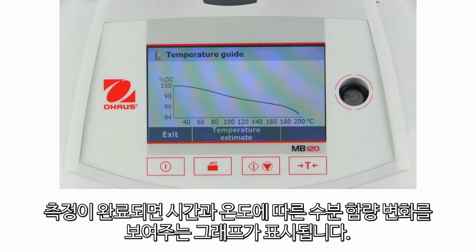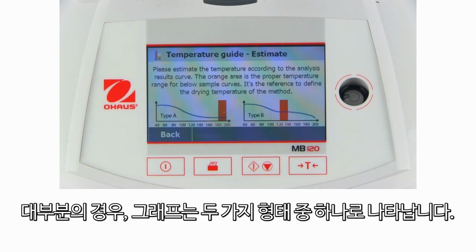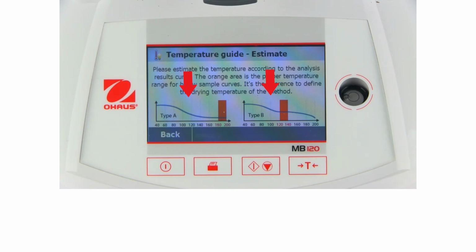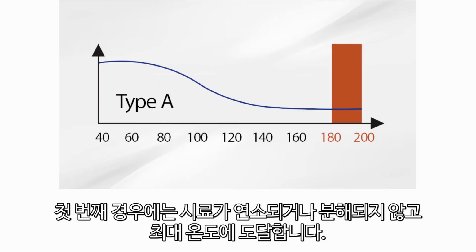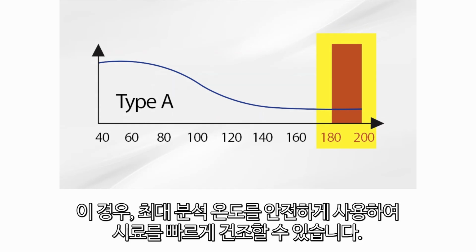Once measurement is complete, a graph showing the dry content change over time and temperature is displayed. In most cases, the graph will appear in one of two ways. In one case, the sample will reach the maximum temperature without burning or decomposing. In this instance, the maximum analysis temperature can be safely used to quickly dry the sample.